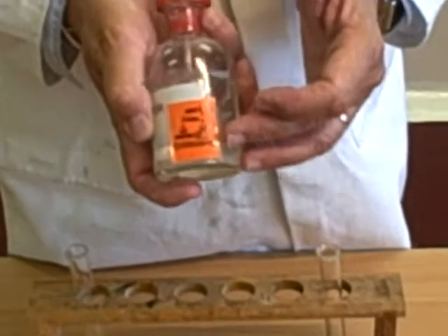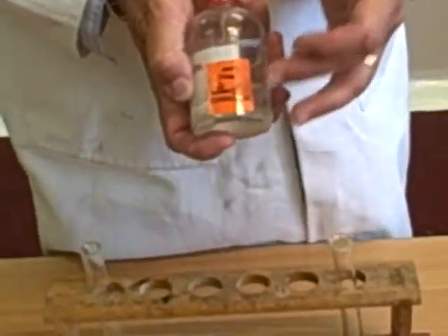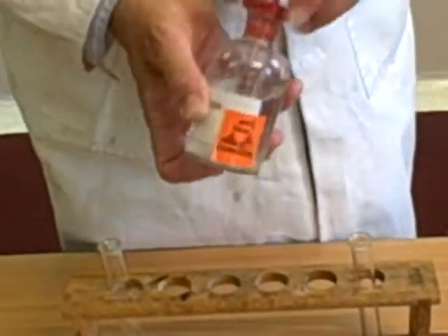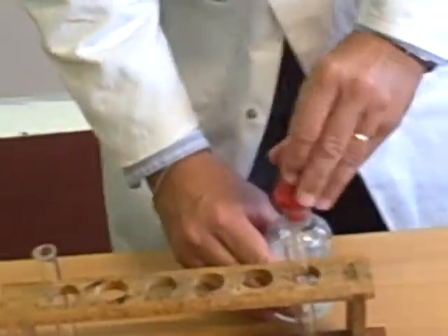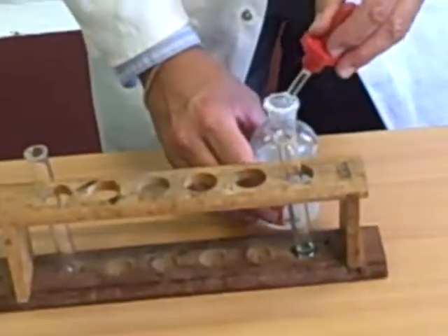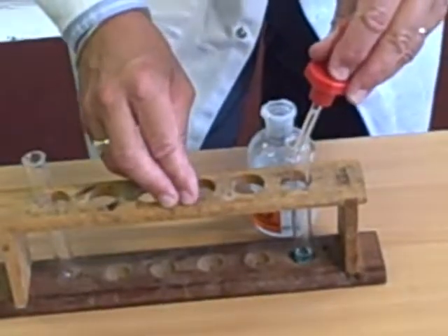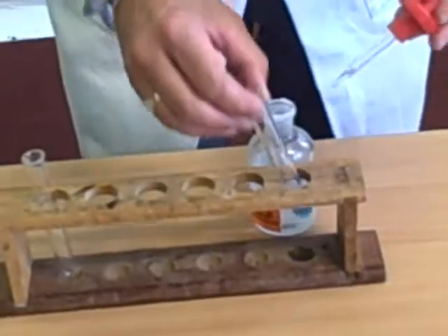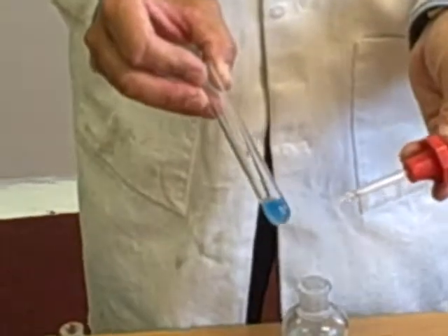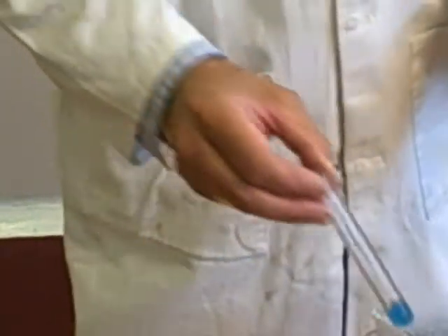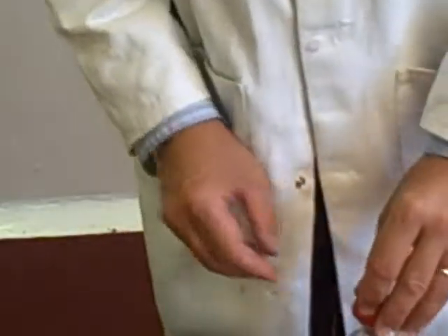What you have now is sodium hydroxide. Sodium hydroxide for your risk assessment is corrosive. So what happens when we add sodium hydroxide to copper chloride? If you look there, we have a lovely dark blue color.